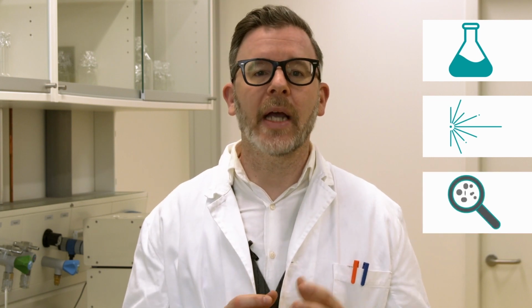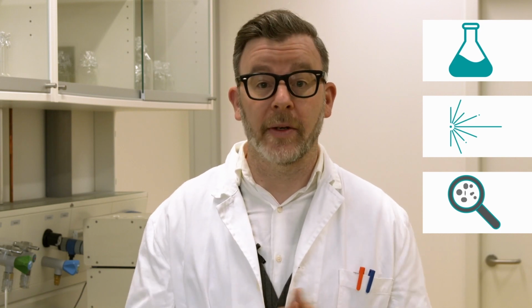And finally, the particle sizes. Depending on the optical contrast, OF2I can measure particles ranging from 10 nanometers to 50 micrometers as number-weighted hydrodynamic size distributions. So what is actually needed to have such a system integrated into your production line?